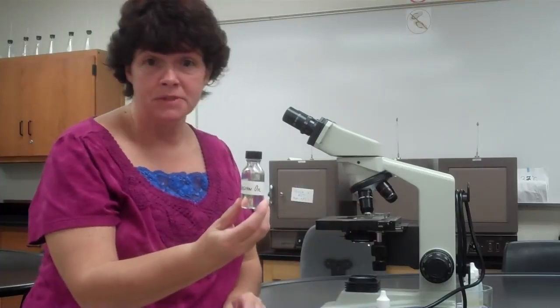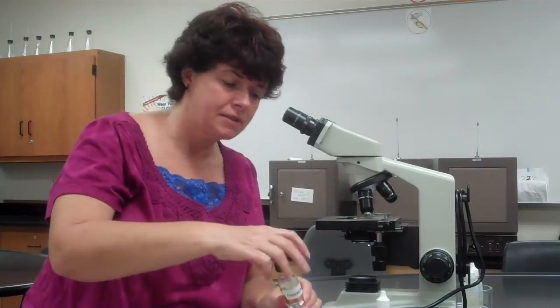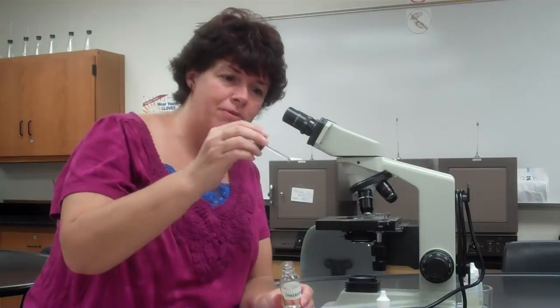So I do not want to put the oil on yet, but I do not want to go to the 100. So what I'm going to do is, see how I'm turning it to where I have the specimen between the 40 and the 100. Now I'm going to take oil. It may be in a bottle like this, or it may be in a bottle like this. Doesn't matter. If I use this, I have a little medicine dropper thing, and you let the oil drop off.